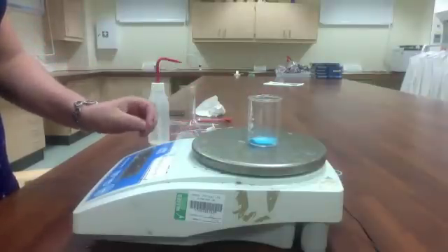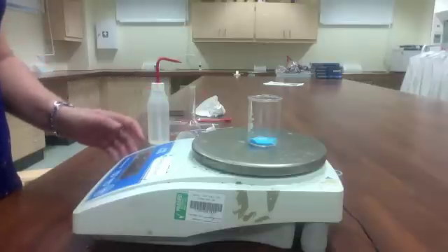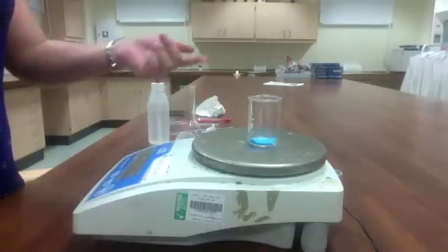Big emphasis on both clean and dry. We don't want to add any water to the solid while we're taking the mass of it.